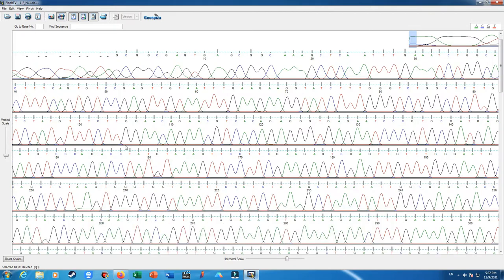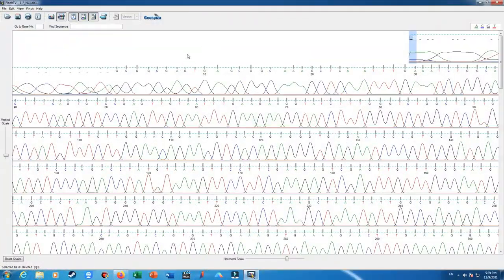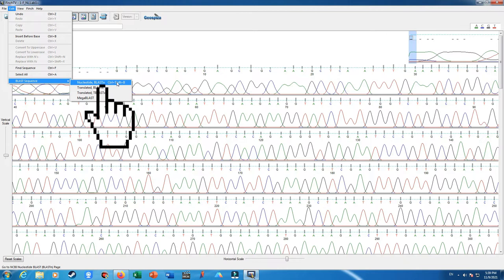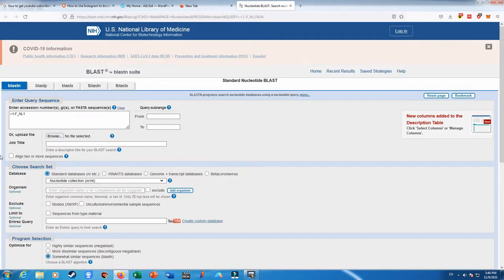So let's see what organism this sequence belongs to. What we are going to do in here is to use one of the FinchTV options provided in the Edit menu, BLAST Sequence. You can choose one of the four provided options, like Ctrl Shift B for BLAST: a nucleotide BLAST, which we are going to use in here, or BLASTX for translating the nucleotide sequence to its coding protein. I choose BLAST, and then NCBI BLAST will pop up in a new window. Okay, as you can see, my sequence is not entered into the query sequence.